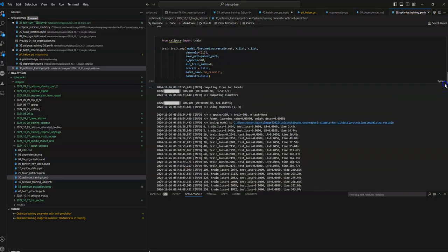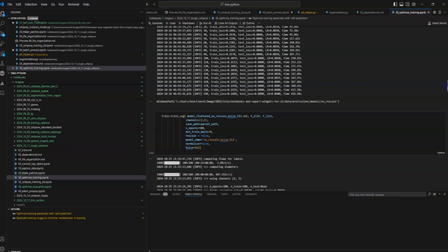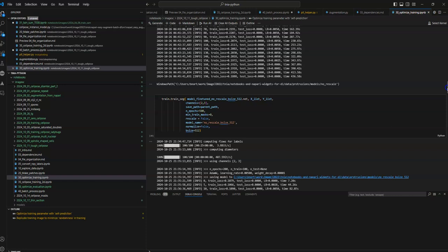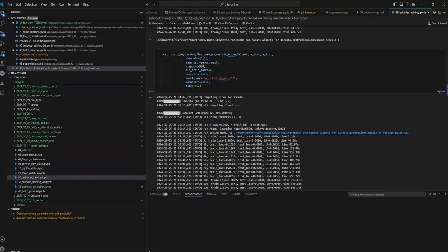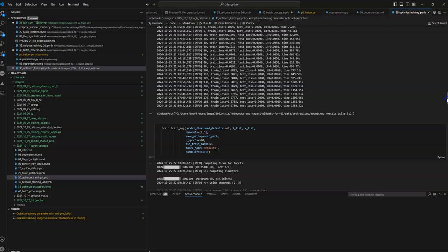I've trained it a few different ways, with a few different settings. One of the settings I've changed is the rescale. For some trials, I put rescale as false. And then I've also done the B size, which is something I thought was important at first, but now I'm thinking, especially based on a little feedback from Carsen Stringer, the author of all this, she says that maybe this one has to be used with care. So I'm not as convinced B size is that important.